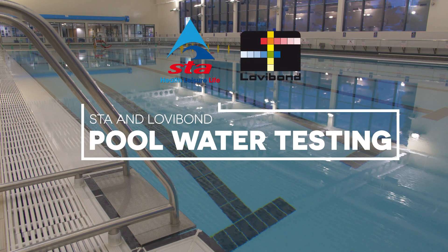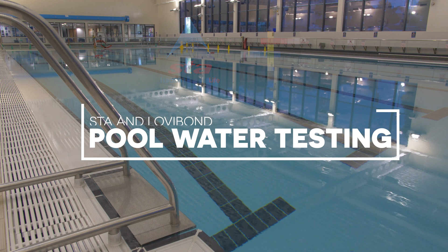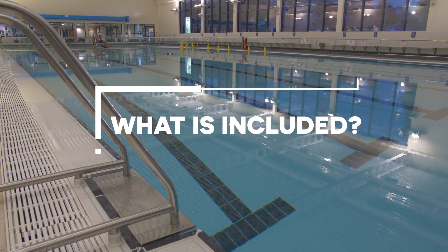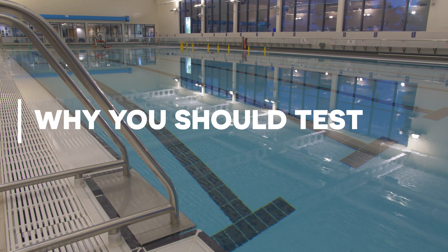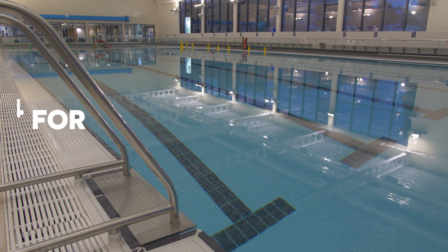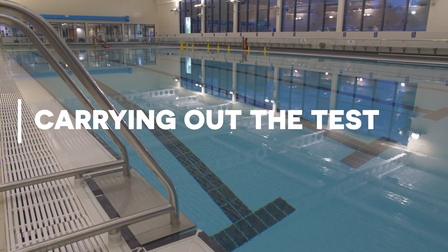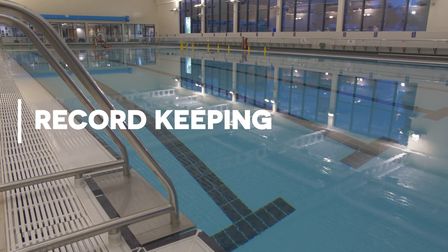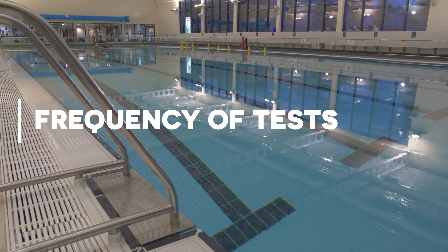Welcome to the STA and Lovibond pool water testing summary video. This video covers the following aspects of pool water testing: why you should test, preparing to test, what to test for, taking the sample, methods for carrying out tests with various pieces of equipment, record keeping, housekeeping, and frequency of tests.